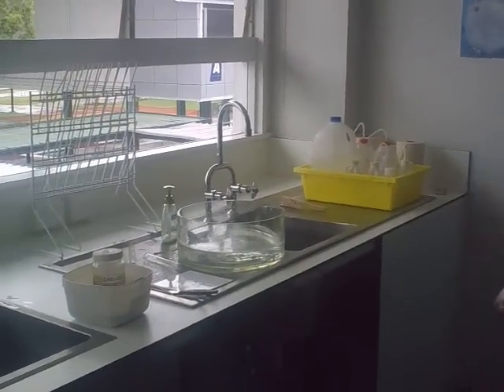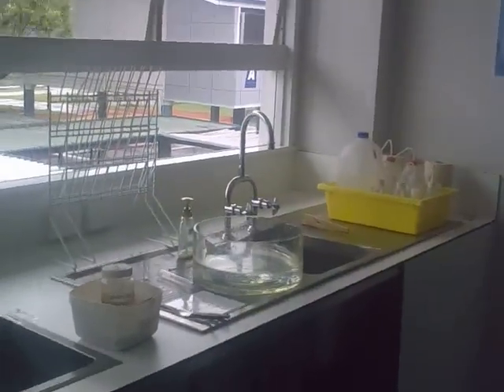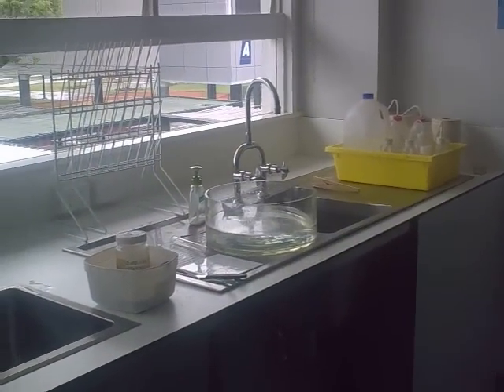Okay. Is that enough? Yeah, back off everyone. Okay. Three. Stand here. Two. Because if it splatters, it'll travel a fair way. Okay, get out of there. Now, is there a bit of water in there? No. She rocked me. The water will get in, don't worry. It will get in, yes, because I've kept a hole in it. Oh, come on.